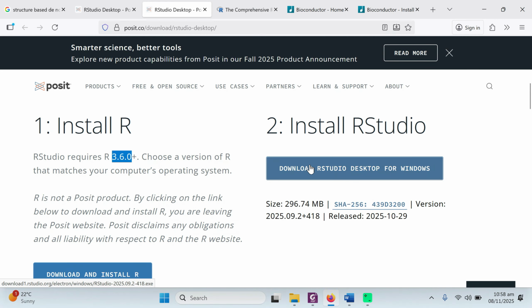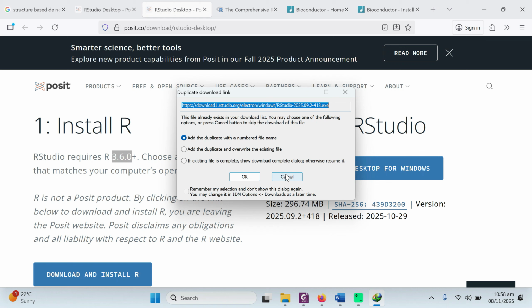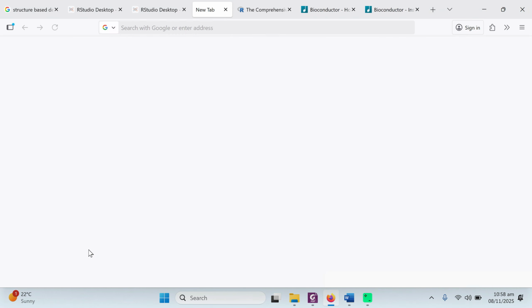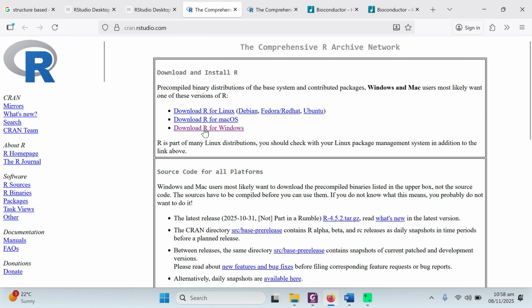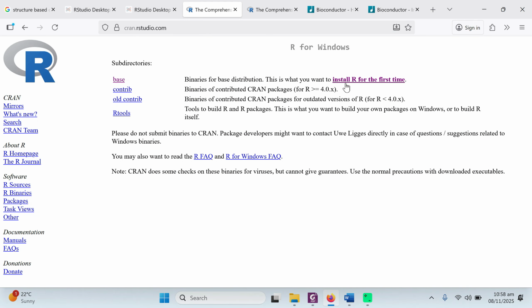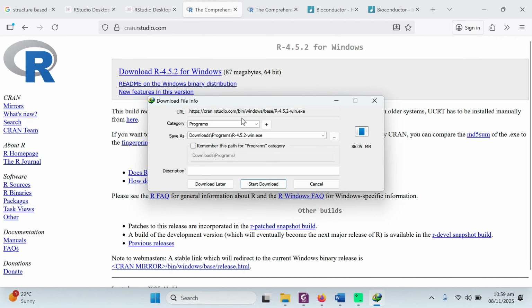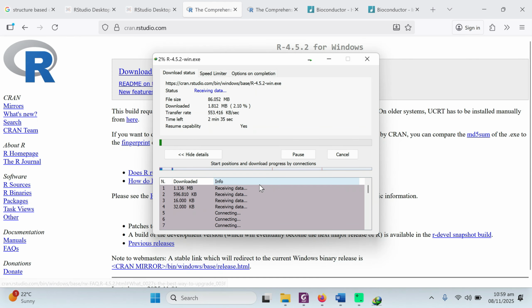When you click on RStudio, it will just start the download and you can download the software. But when you click on the simple install, it will open a new page and you need to go to download R for Windows. Click on it and click on install R the first time. Click on it. When you click on it, it will show you the latest version. The latest version right now is R 4.5.2 for Windows. Click on it. It will start downloading your R.